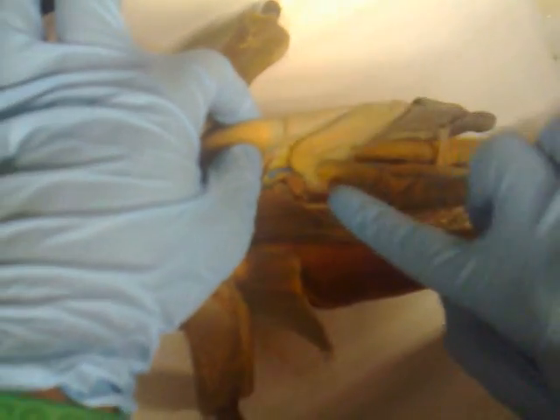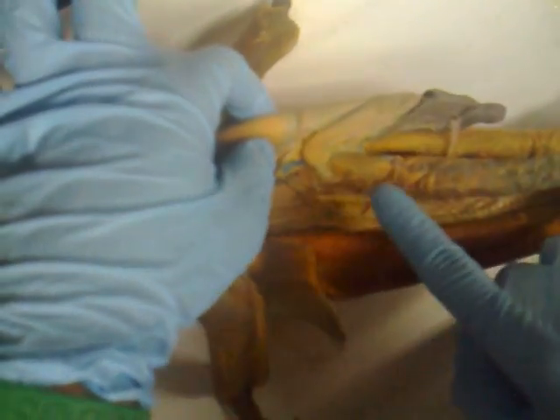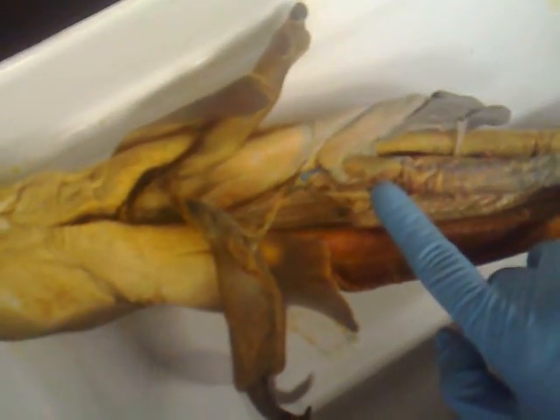This is the duodenum. This is the ileum. This right here is the duodenum. This is the ileum. This is the rectum.